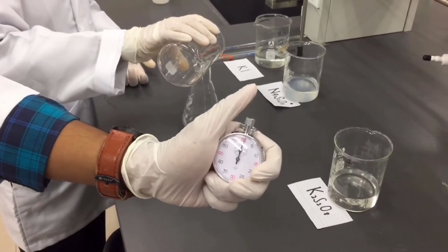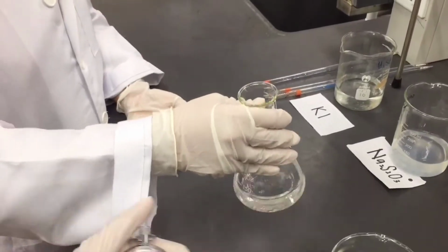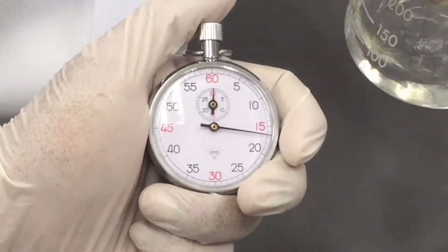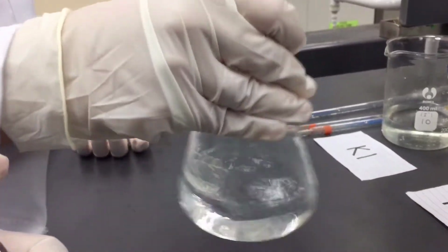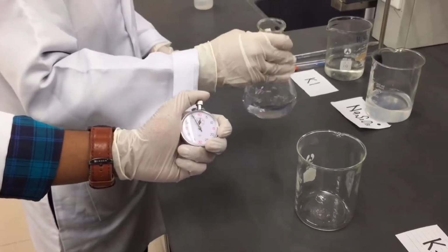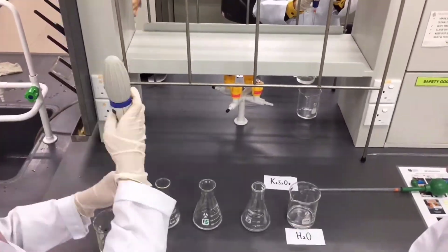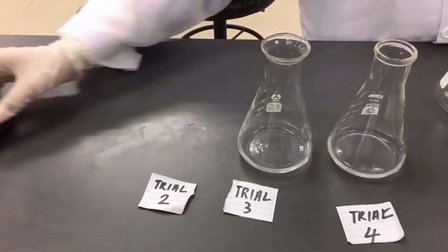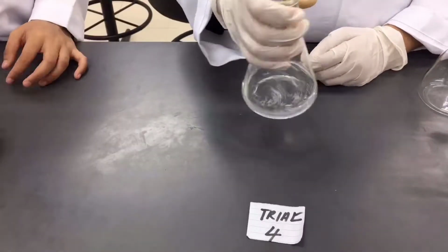Then, begin timing as soon as the peroxydisulfate is added and immediately swirl the reaction to ensure good mixing. Stop timing when the solution changes to blue. Then we proceed with trials 2, 3 and 4 with the different volumes of potassium iodide. Each trial was performed twice until reproducible reaction times are obtained.